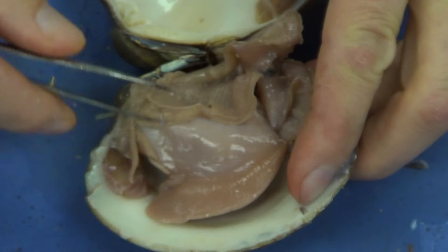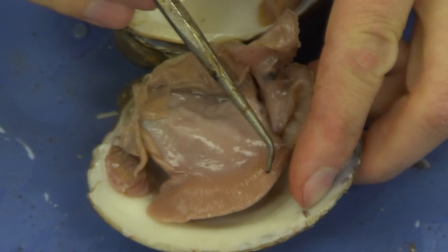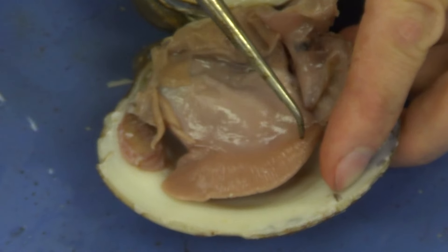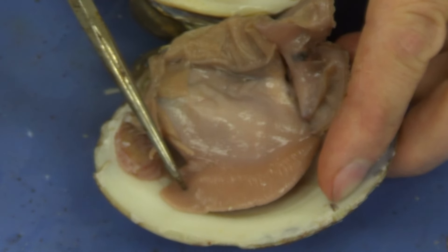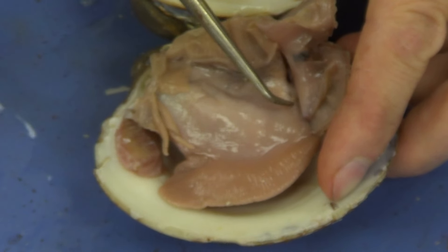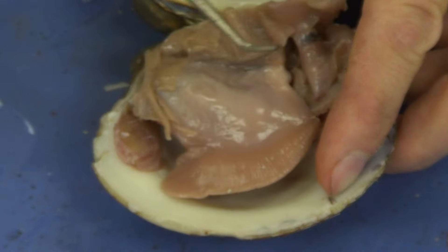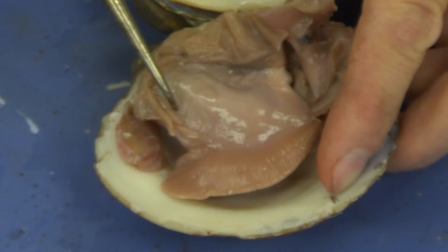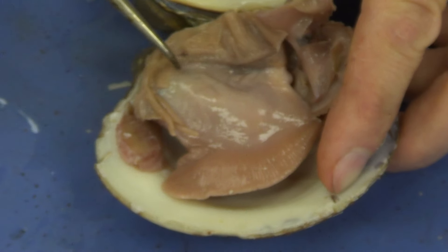Now I'm going to remove the gills out of the way. The next structure I see is this large muscular structure — this is the muscular foot. This is what molluscs, which a bivalve is, are kind of famous for. Molluscs have three characteristics, one of them being a muscular foot. This muscular foot is used to dig into the sand. A little further, we see the color and texture of the tissue change, and we come to this large, shiny, soft mass referred to as the visceral mass. Viscera meaning organs — inside here are the gonads, the stomach, the intestine, and the digestive gland.